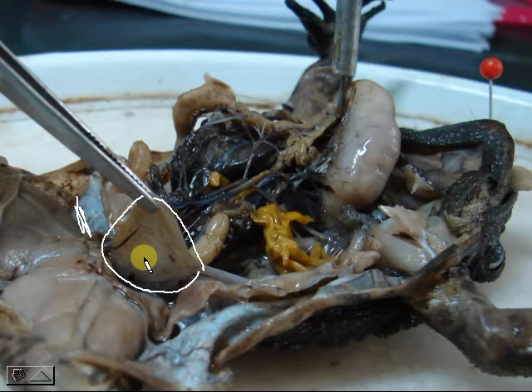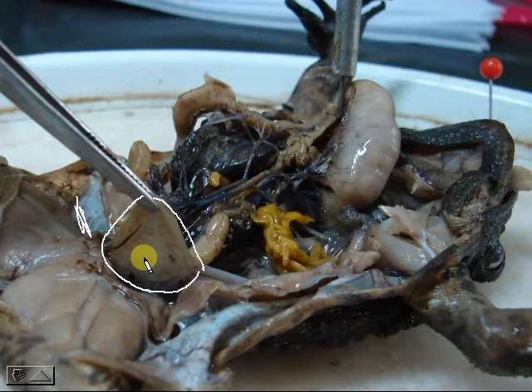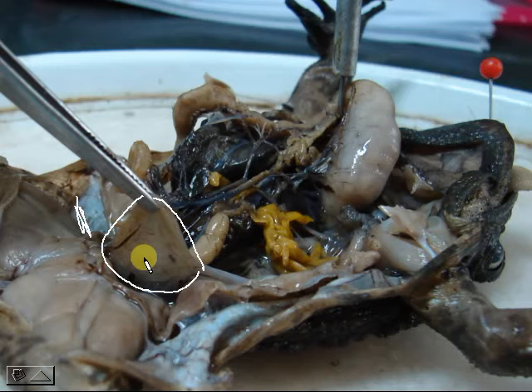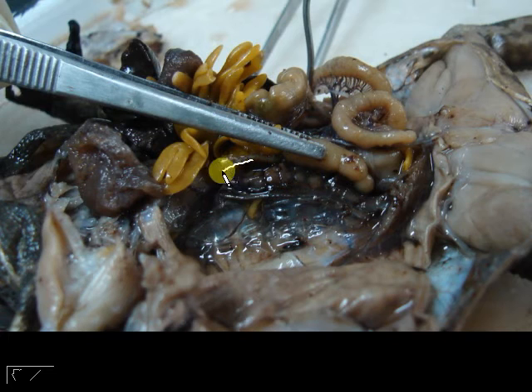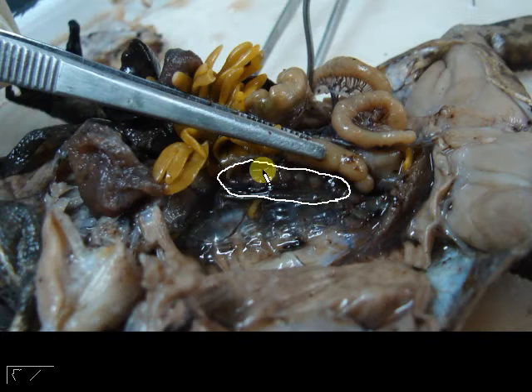In freshly dissected toads, you will see that the urinary bladder is usually a clear bag, and if you are lucky there is actually liquid inside, which is urine. So if the toad has a full bladder, you are going to see a bit of liquid inside.